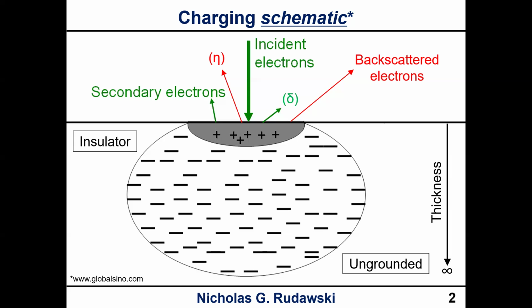I can also have the case where my electron goes into the sample, but I also generate what are called secondary electrons from within the sample that also get ejected. Depending on the dynamics of these two processes, you're going to end up with some kind of charge distribution in your specimen. In the case of an insulator, we potentially end up with a net positive charge at the surface, because we're ejecting all these secondary electrons, which tend to come from the surface.